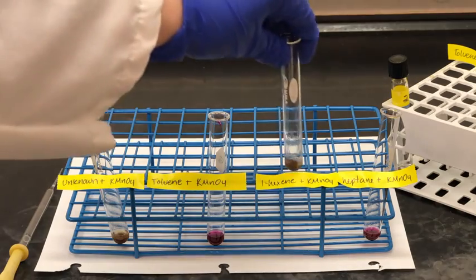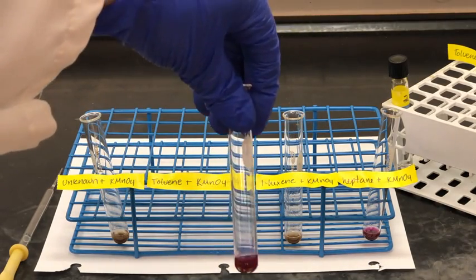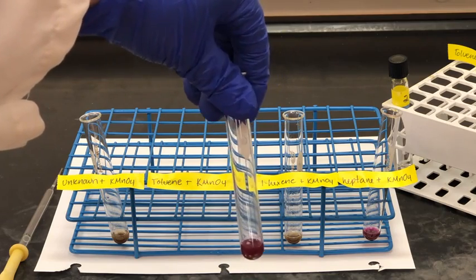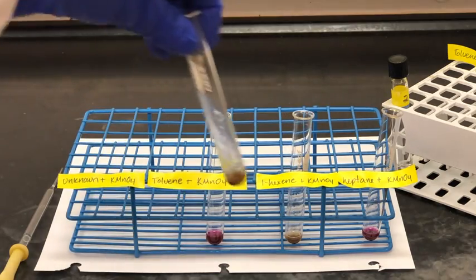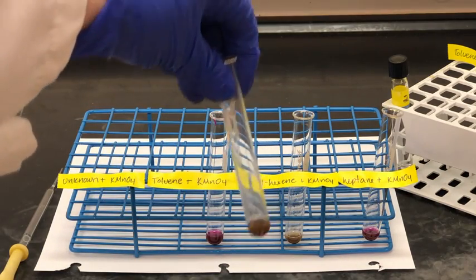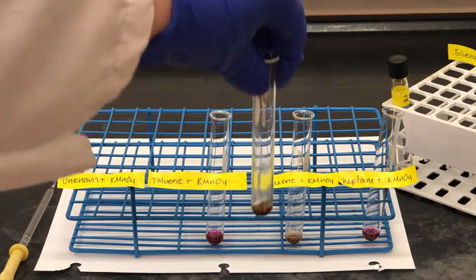So here we have 1-hexene. Here is our toluene solution, and again, you can pause the video to make any necessary observations. And our unknown. Okay, so what can we conclude about our unknown and its functional group?